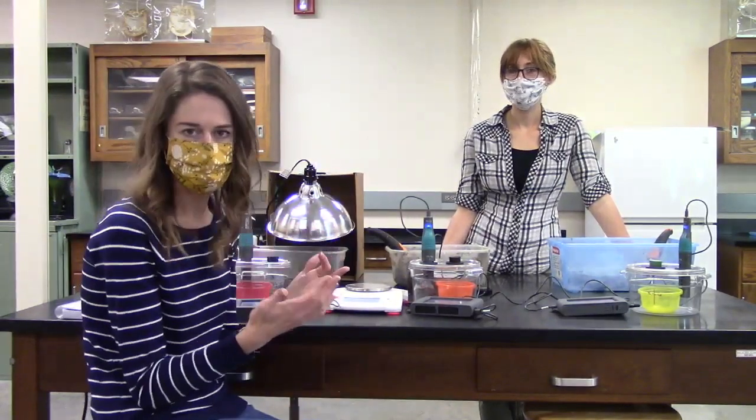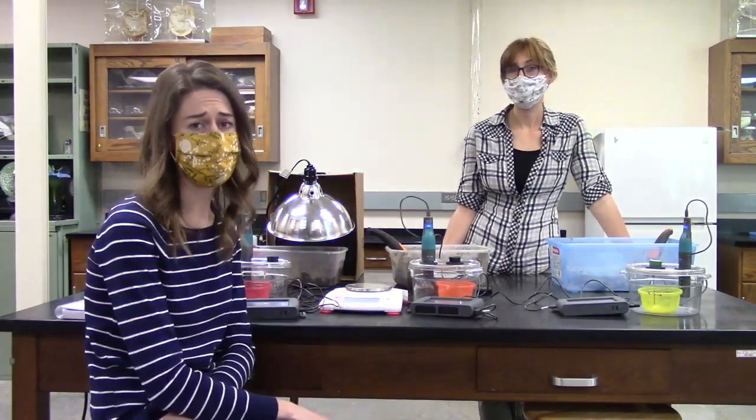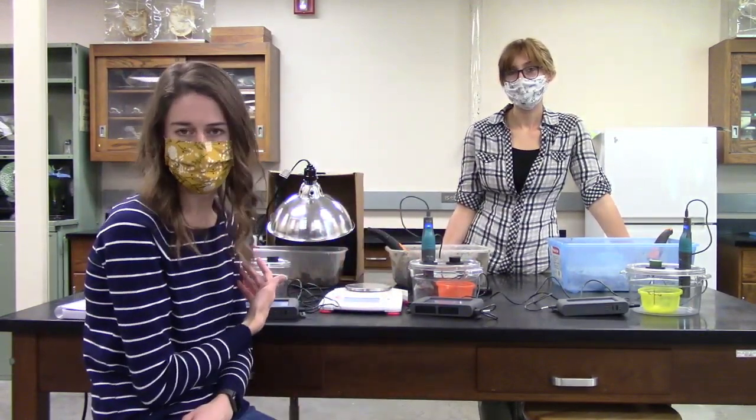So when we go to use a little bit for our experiment, it stays fairly warm while we're actually doing things with the soil. We're going to take just a small sample from each of these bins and use it to measure basically the change in CO2 in these different experimental treatments of our soil.